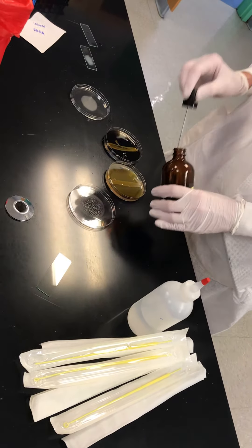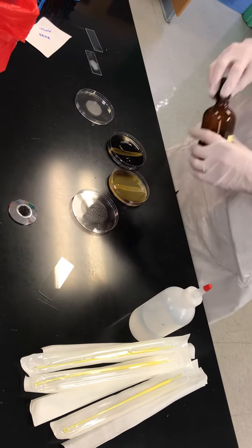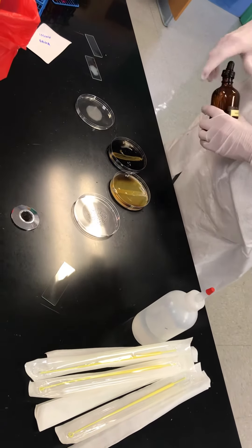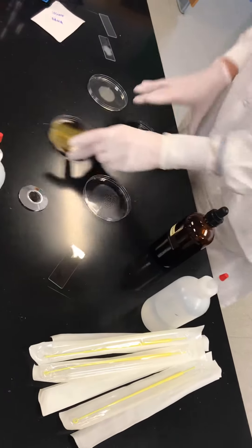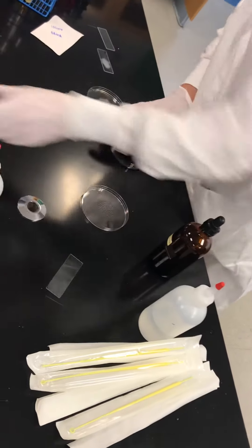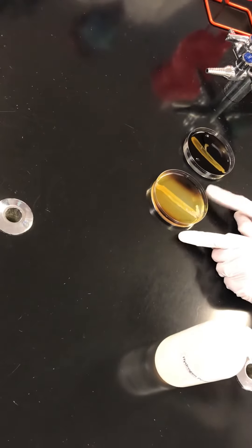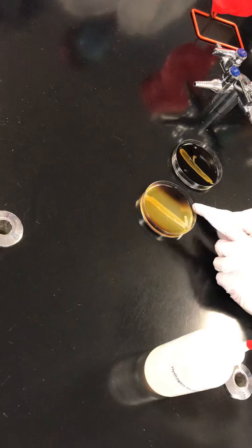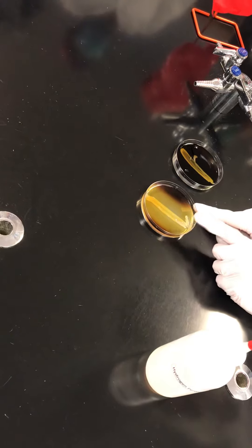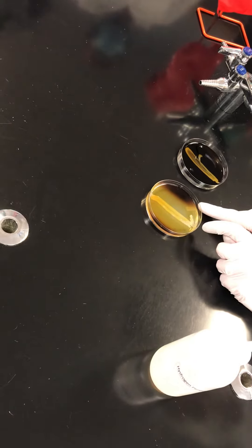This is another one that people get confused about all the time. If you come look, this plate where you only see the starch far away from the organism means that the enzyme is secreting the amylase — so it's positive for amylase.